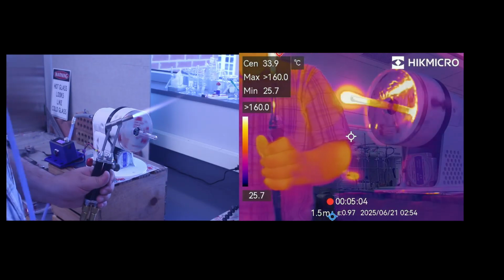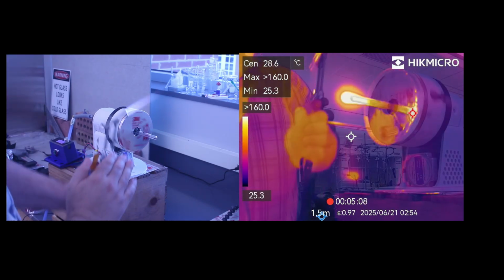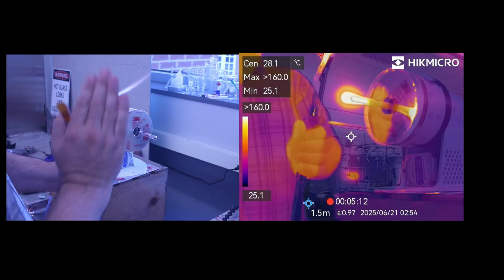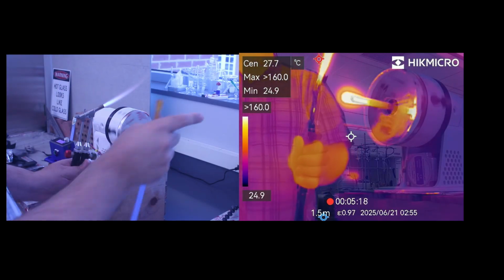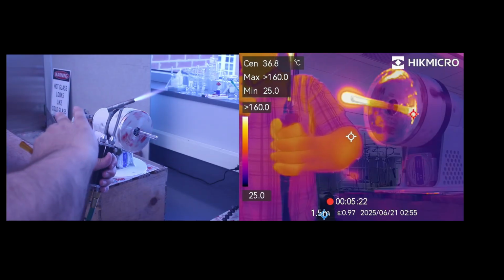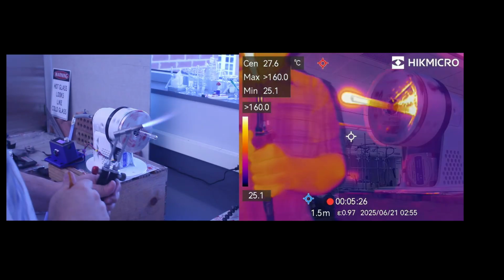And I'm not blowing very hard at all. I heat up the glass, it becomes molten. I take the flame away, let it cool for just a moment, and then puff into it to get the shape that I want. If you get it molten and you blow into it, you'll cause the glass to expand way too rapidly, and it'll either just kind of balloon animal on you or even pop.